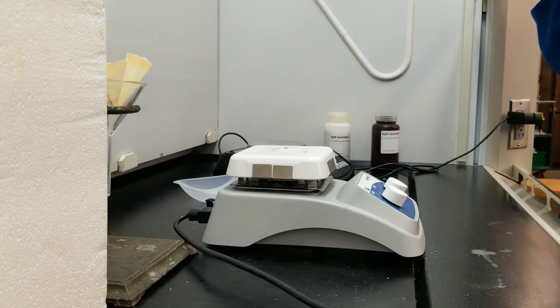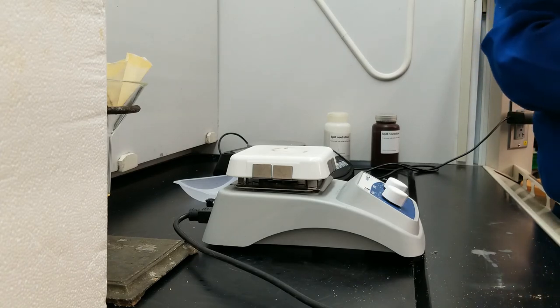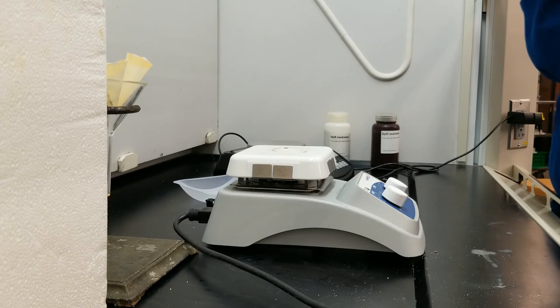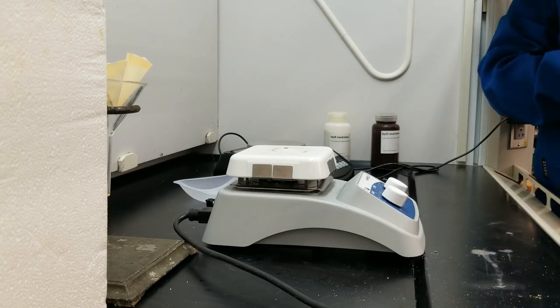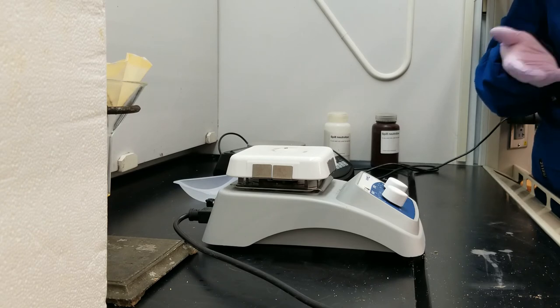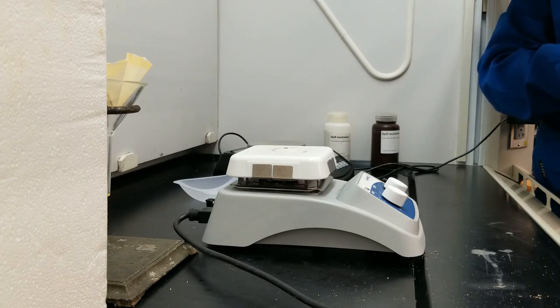What I'm doing here is I'm just checking whether the fats of the potato chips are saturated or unsaturated. The more saturated the fats are, the more likely that they will solidify in the ice bath. So there aren't any numerical measurements to be taken here, it's just seeing if it solidifies.